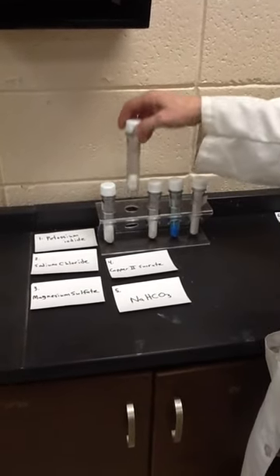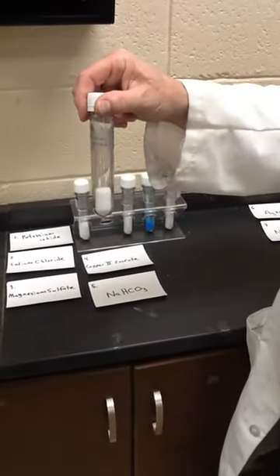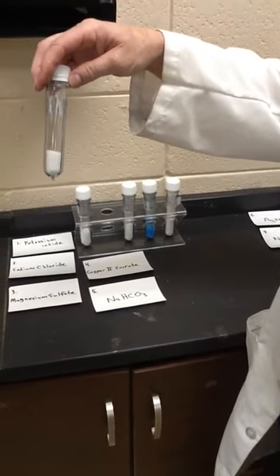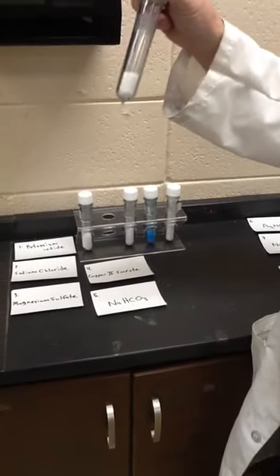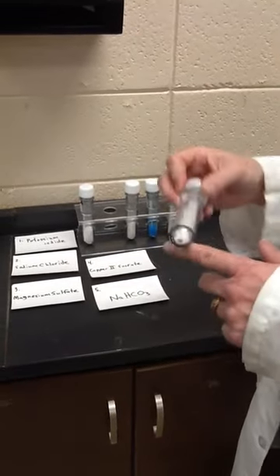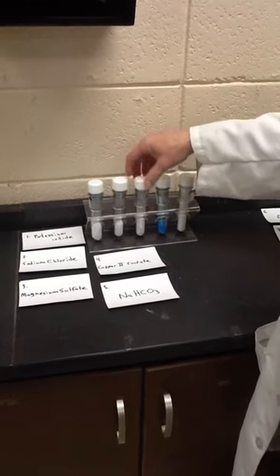The second one is sodium chloride, plain old sodium chloride. This is my laboratory grade sodium chloride. It doesn't have sand in it or silicon aluminum carbonate or whatever they put in the Walmart salt. Yes, there's sand in there. That's why it's cloudy when you make your salt solutions. But that keeps the salt from clumping. So nothing helps completely in Arkansas. We're very humid here.